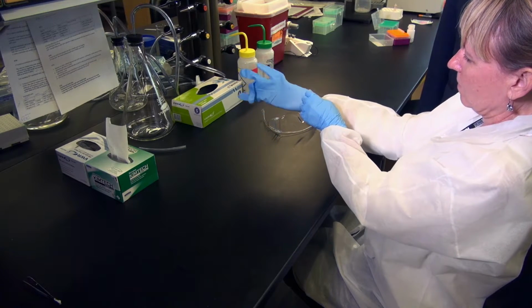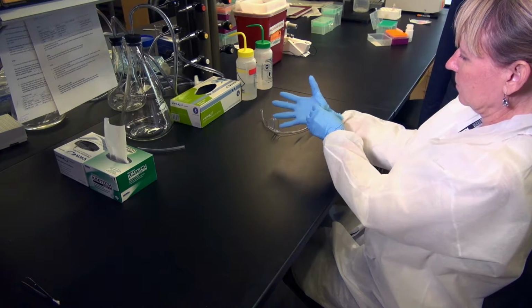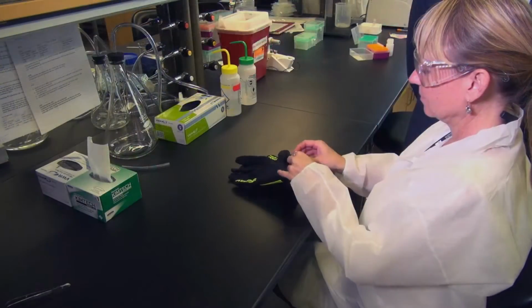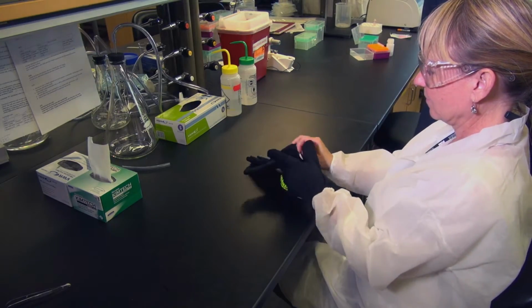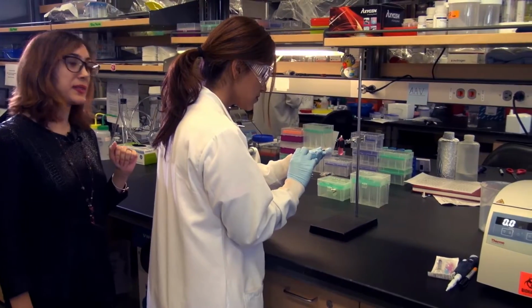So when working with needles, you should wear the proper personal protective equipment. This includes gloves, a lab coat, and proper eye protection. You may also want to consider additional protective equipment, including puncture-resistant gloves. You can see that this scientist is doing this exactly right.